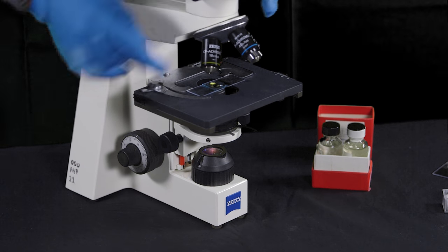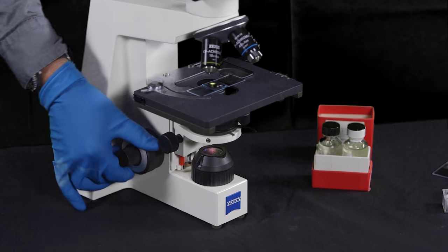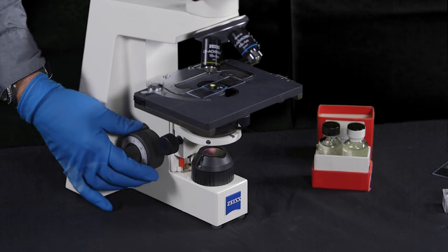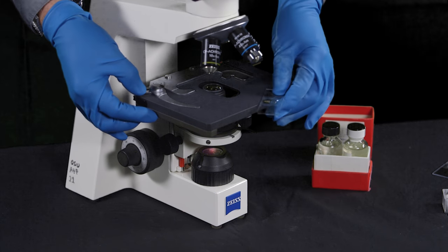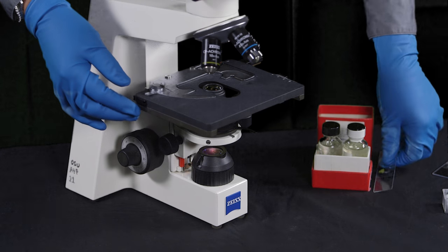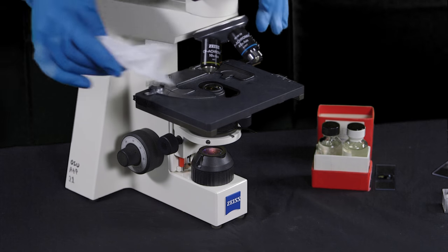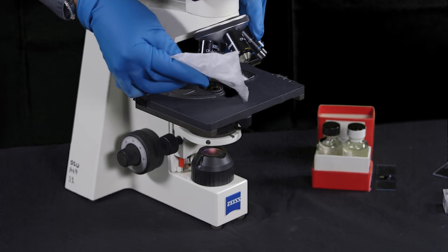Once done viewing the specimen, the stage should be moved all the way down, the slide should be removed, the immersion oil should be cleaned off of the 100x objective and then cleaned off of the slide.